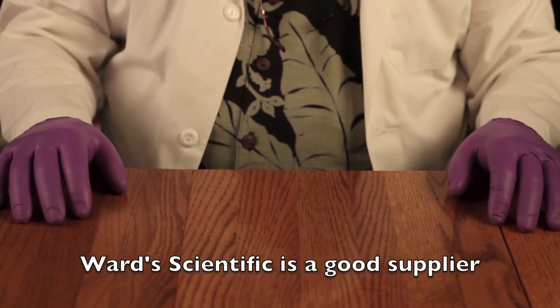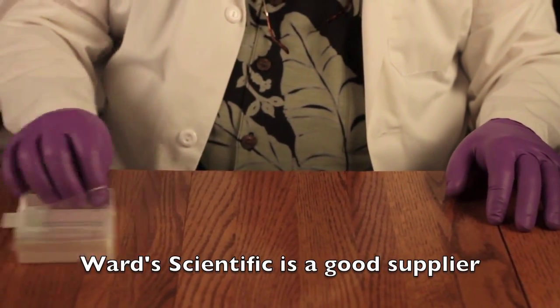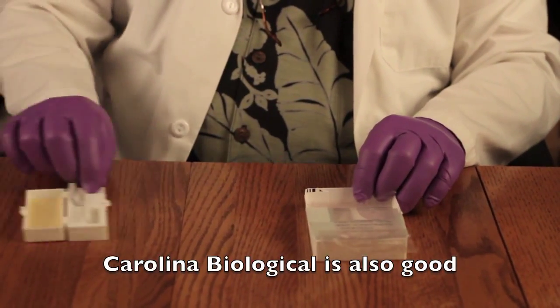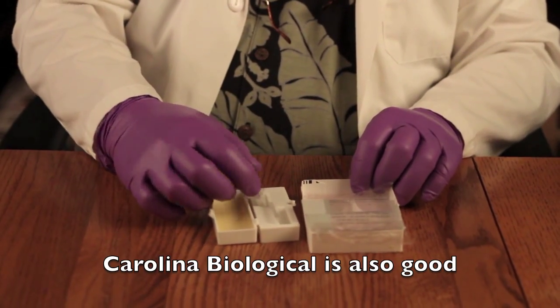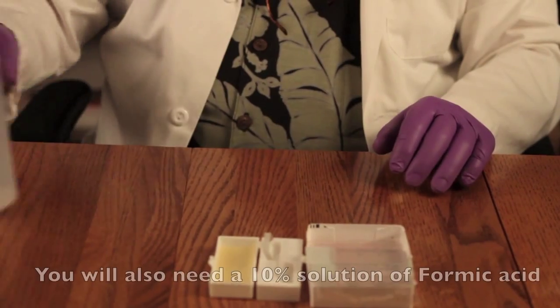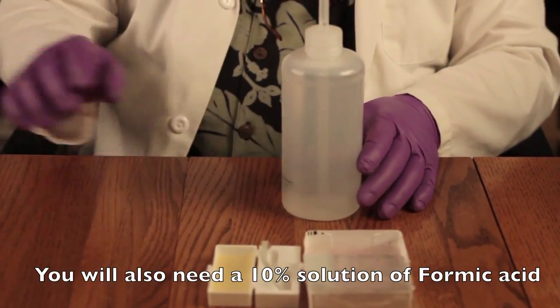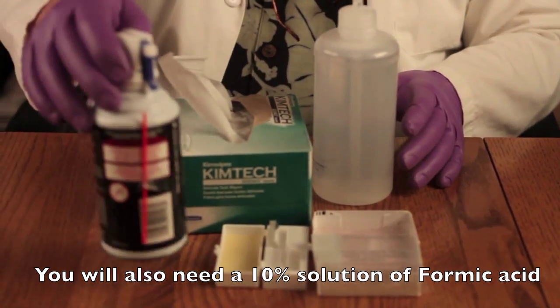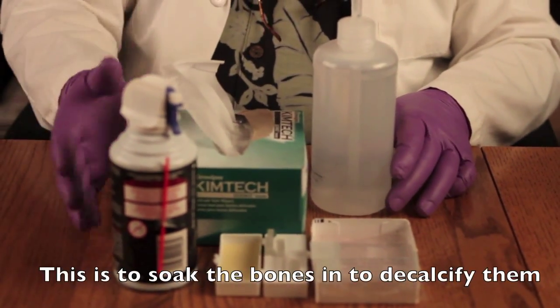Let's discuss what you're going to need to do this experiment. First, you're going to need glass slides — buy good quality slides that don't have grease or oil on them. Make sure you buy glass cover slips, a number one or a number one and a half. You'll need to wash these, so you'll need plenty of distilled water, and Kim Wipes to dry them, plus a compressed can of air to blow off any remaining debris.